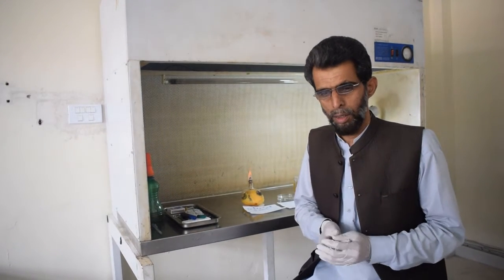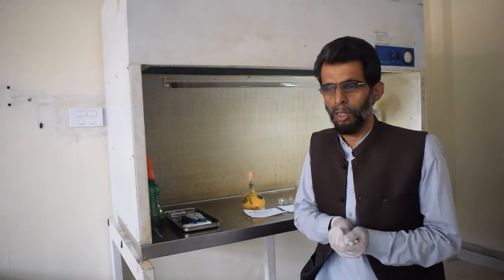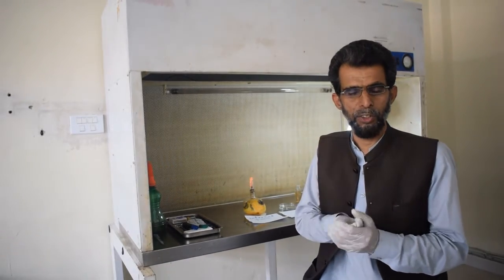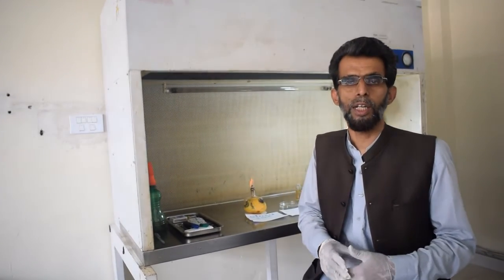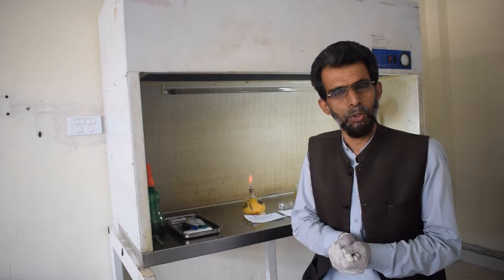Bismillahirrahmanirrahim, Assalamualaikum dear guys. Today I am here to demonstrate the isolation of fungi, and similar is the case with bacteria from infected fruit or any infected part. The procedure is the same.